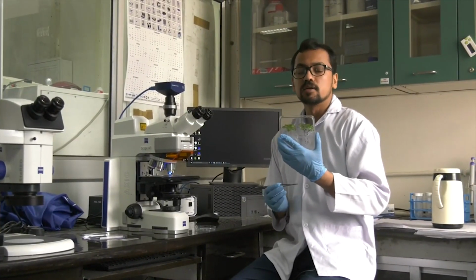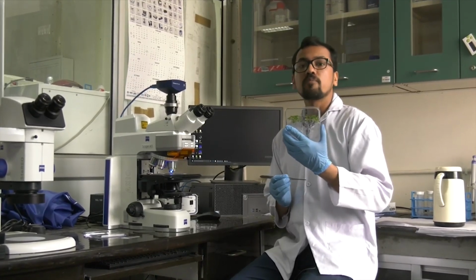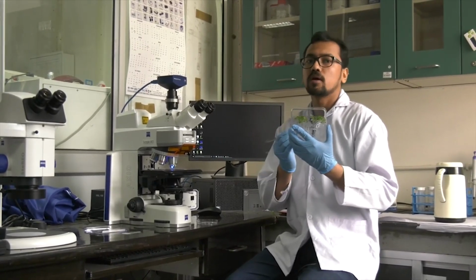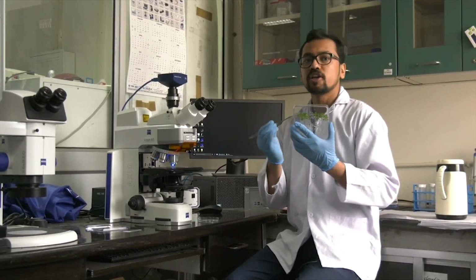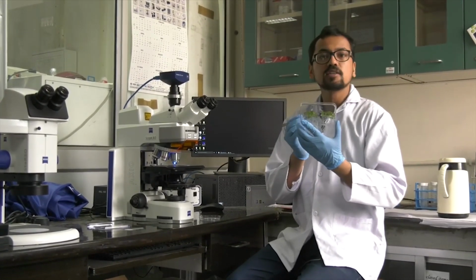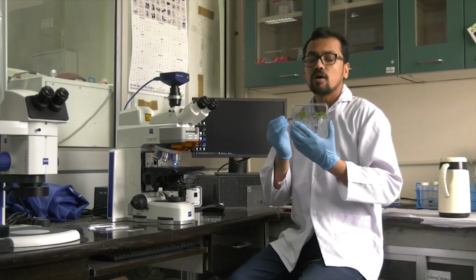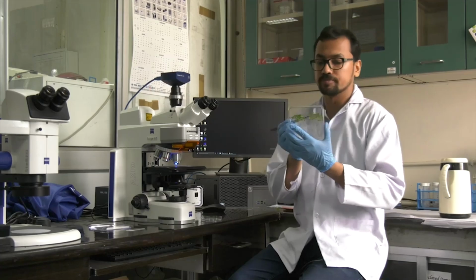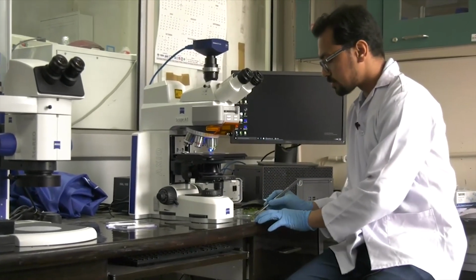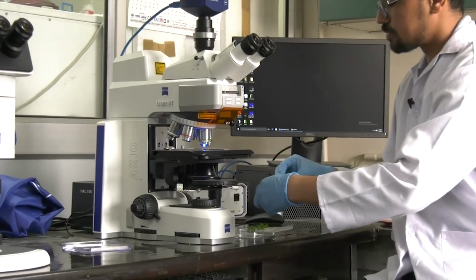Here we have placed DR5 promoter, and downstream of DR5 promoter we have placed GFP. So wherever there will be auxin maxima, DR5 will get activated, and hence GFP protein will be made and a green signal will be observed. So we will take this and see under the microscope how and where the auxin maxima is formed. So we will take this Arabidopsis and place it on a slide and see it under the microscope.